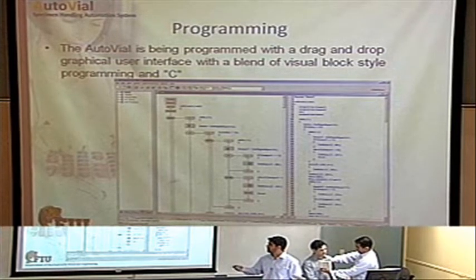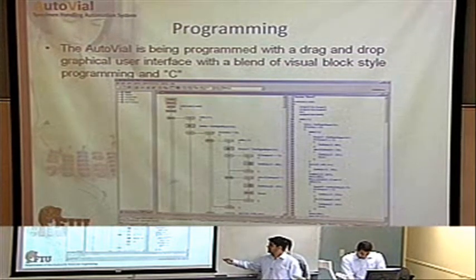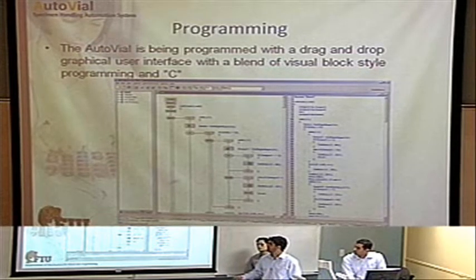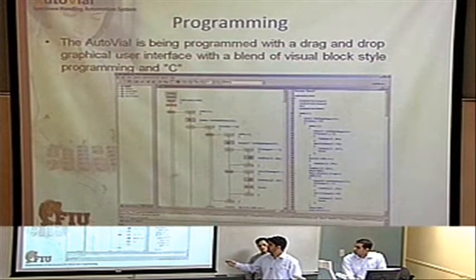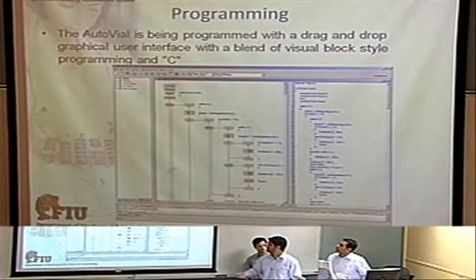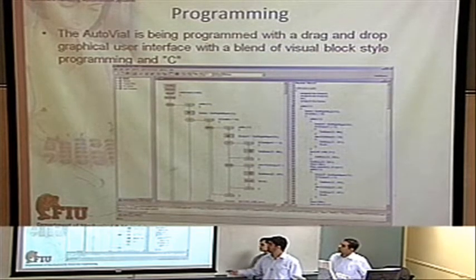sub-functions. You can recall them as many times as you want. Here it gives you the breakdown in actual C code, so you can quickly check if it makes sense, if you're doing it right. The setup actually helped us a lot in optimizing it. It kept everything nice and neat, and we didn't have to read through a whole bunch of code trying to find where we made a mistake.